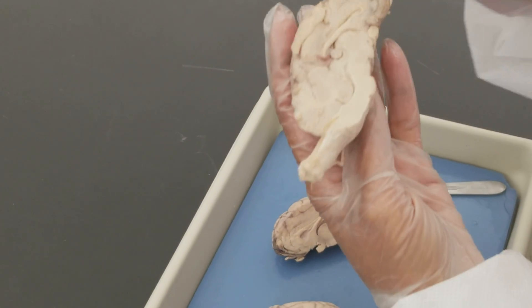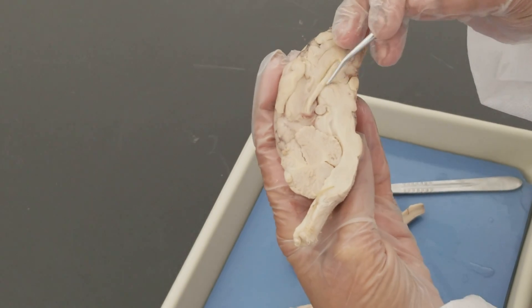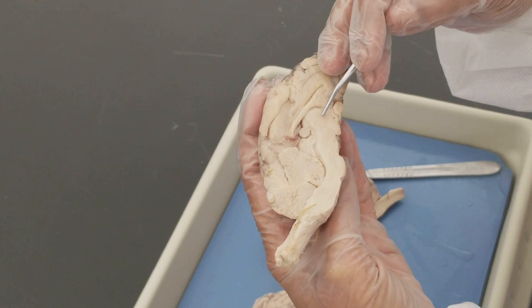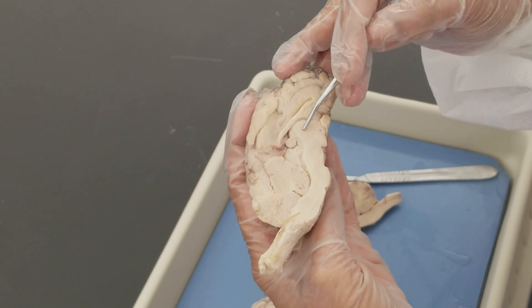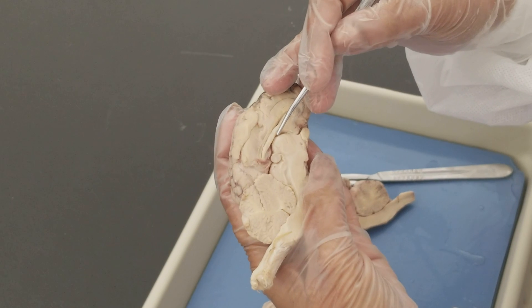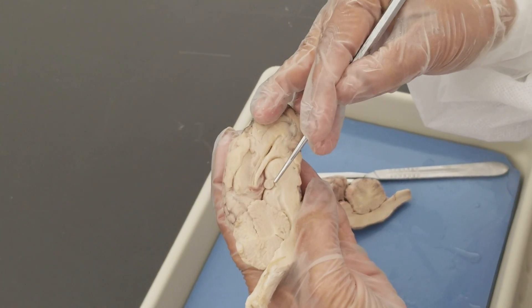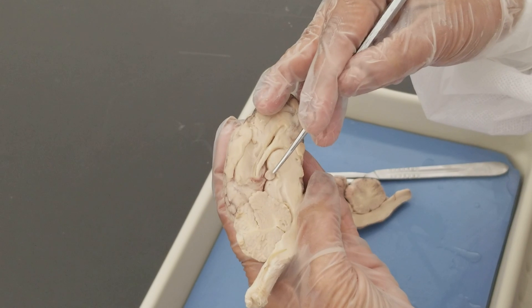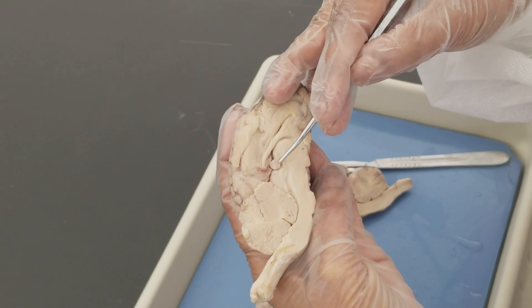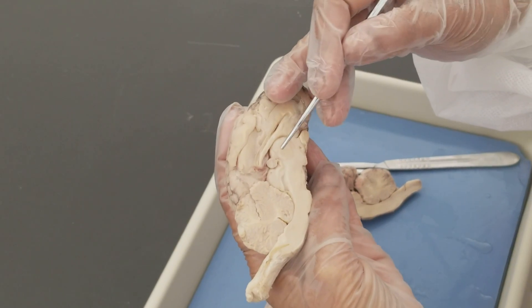Under the fornix you see this round, egg-shaped structure — this is the thalamus, part of the diencephalon. The diencephalon has three parts: thalamus, epithalamus, and hypothalamus. Above the thalamus is a thin layer of epithalamus, which houses an important endocrine gland — the pineal gland. The pineal gland makes the hormone melatonin that regulates your sleep-wake cycles.